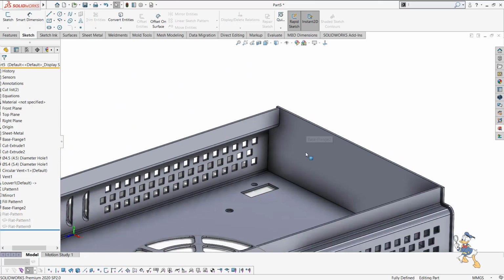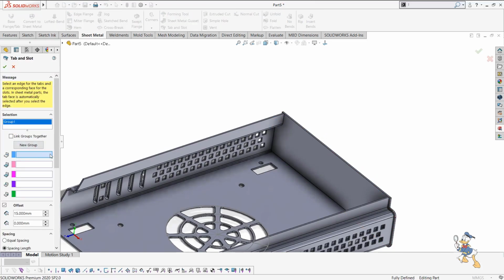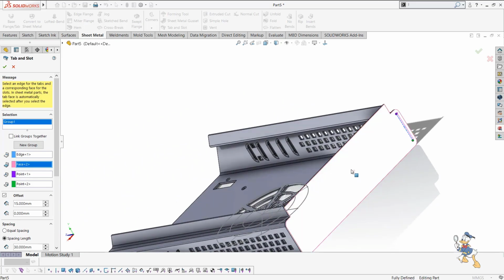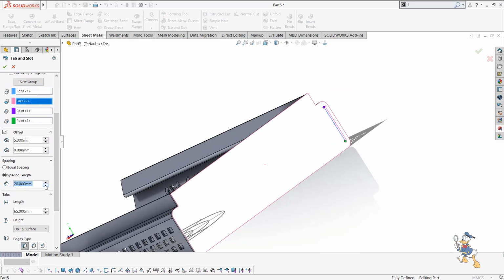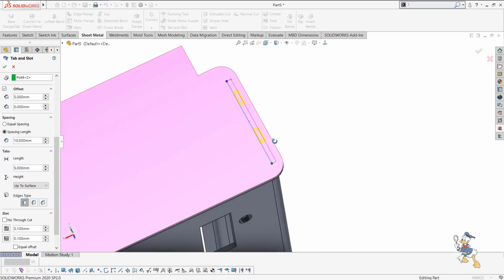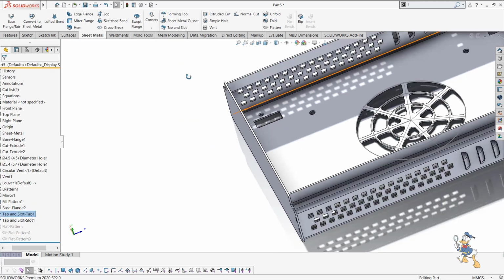So for joining these two parts, we have another feature in sheet metal which is known as tab and slot. Usually while welding we just need to have some guidance for generating this kind of parts. So by providing this kind of feature, I just need to provide an offset distance of like 5, and the spacing length would be like 10, and the total length of the feature would be like this. And I just need to check it out. It is showing a preview of slots to me, and it seems okay to me. I just need to tick over here, and yeah, the tab and slot is generated.